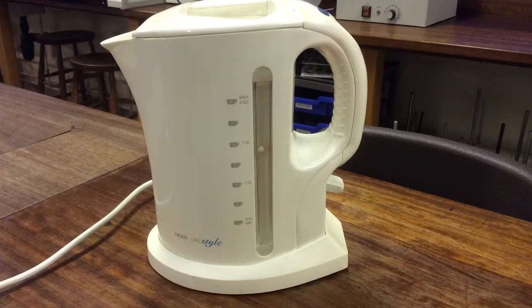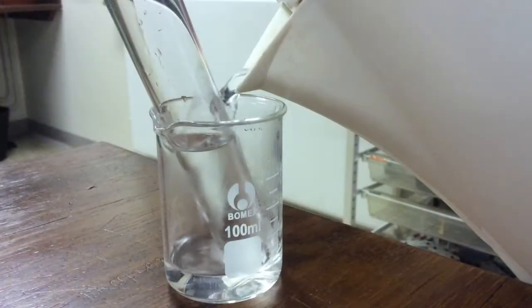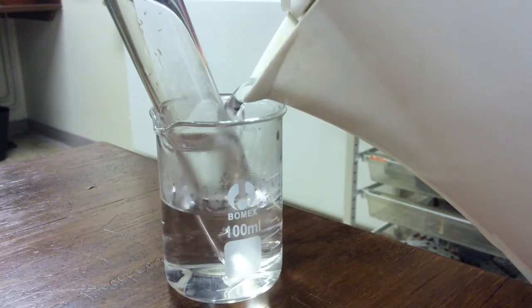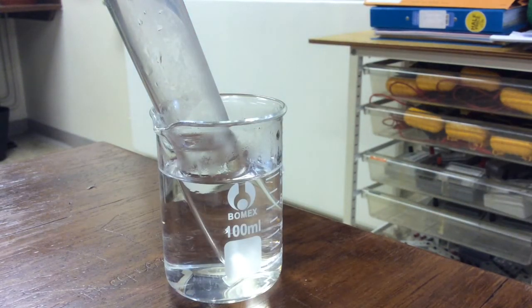Hopefully during this time the kettle is boiled. Carefully pour the hot water into the beaker around the outside of the boiling tube.